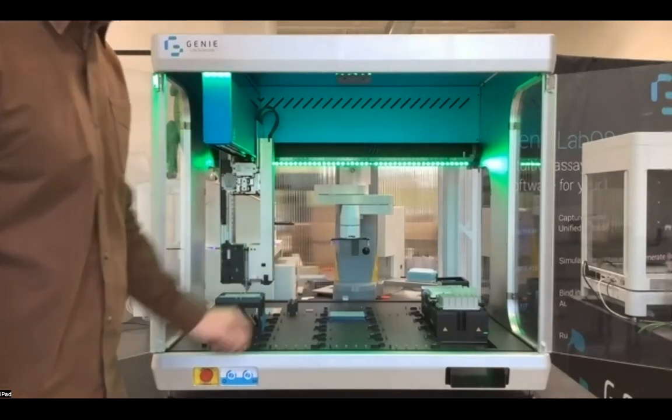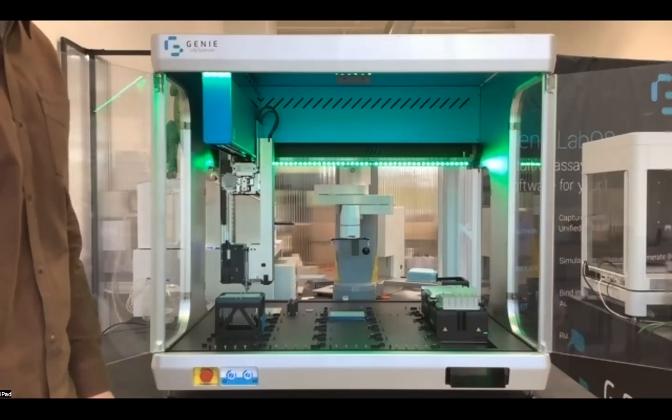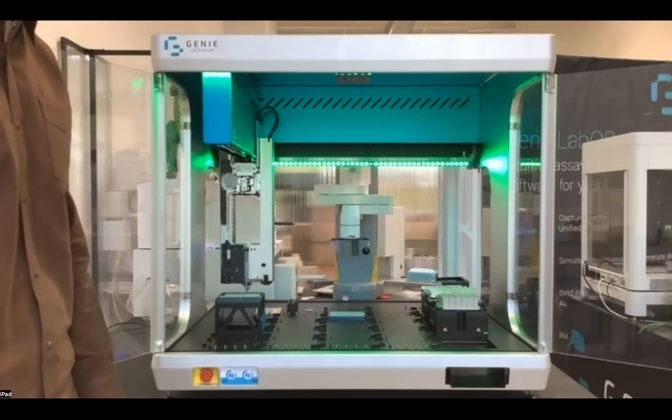The seals on the head are a novel design allowing for tip pickups across a wide variety of tips. So you have the ability to source several tip types from us and be guaranteed to always have a supply chain of those.